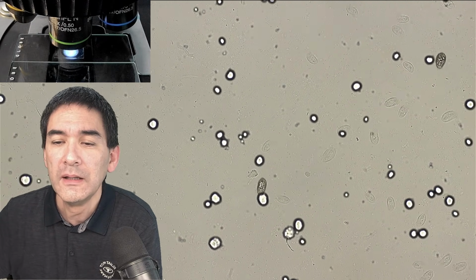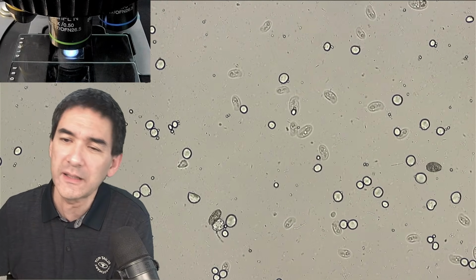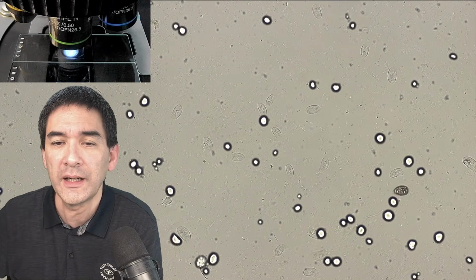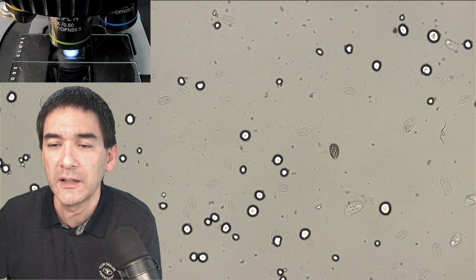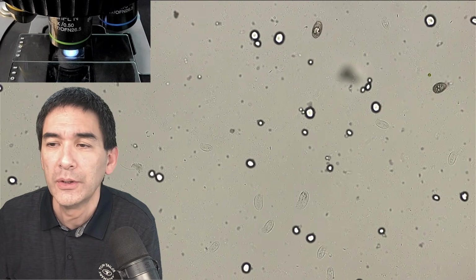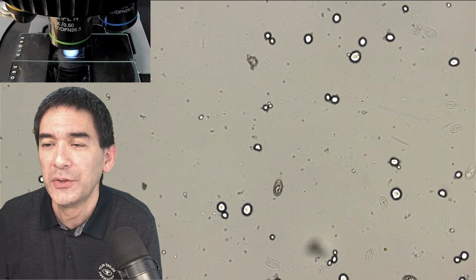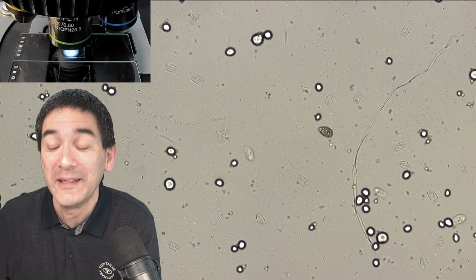And what you see here is something that I found slightly disappointing, but not surprising: the biodiversity is actually not that high, right? You see two different types of ciliates here. Of course, I tried to identify them. I was not able to find exactly the same one in my identification book. And the biodiversity is so high anyway that chances are pretty good that they're not in the identification book in any case.